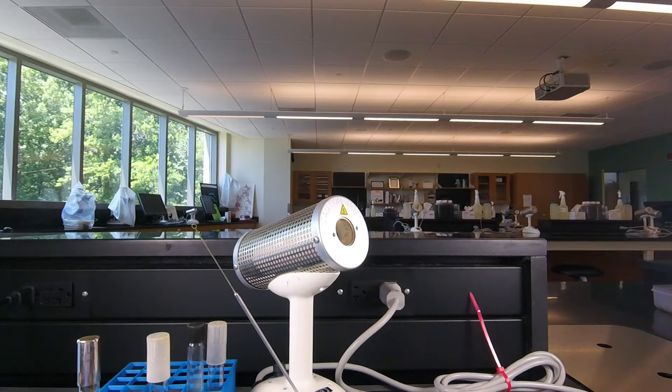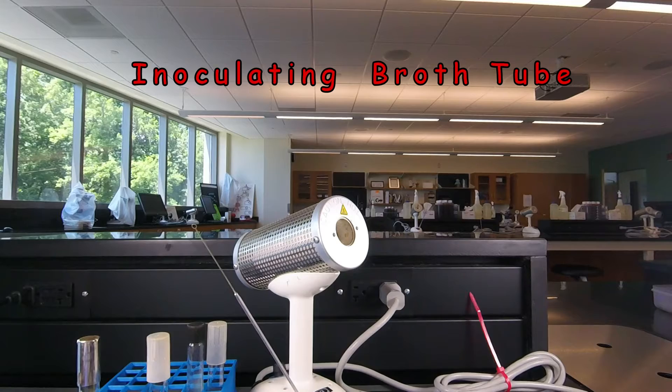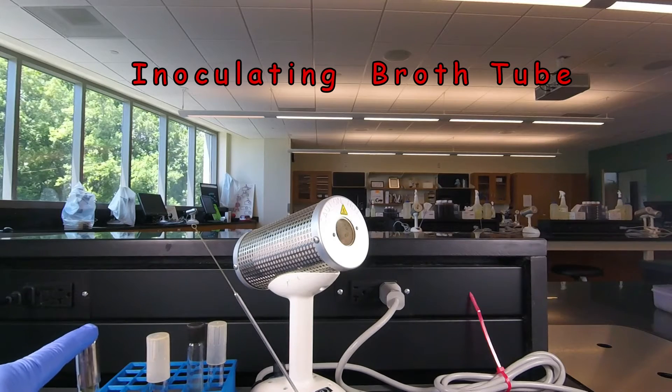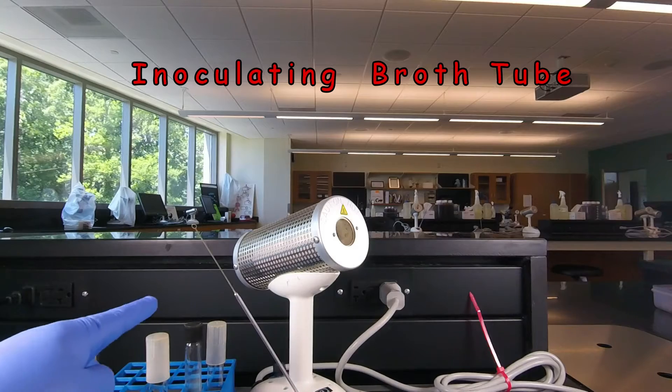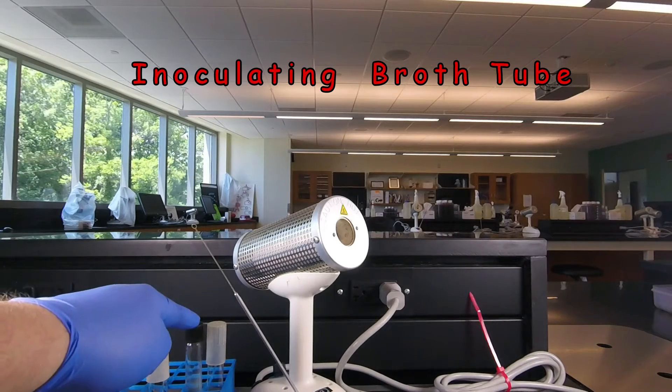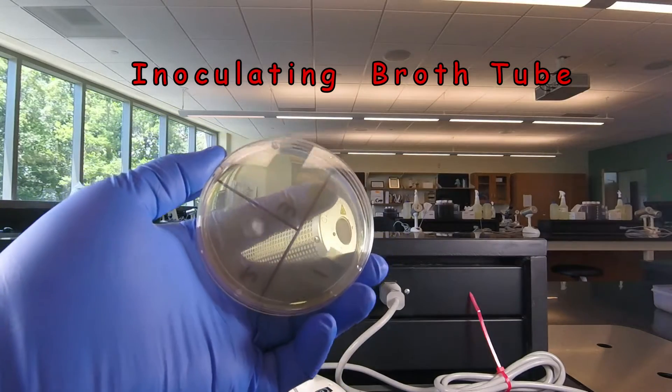Welcome to our lesson on aseptic technique. In this lesson we're going to learn how to grow bacteria in the different forms of culture media that we had in a previous lesson: growing them in a broth tube, on a slant tube, in a stab tube, and on a petri plate.